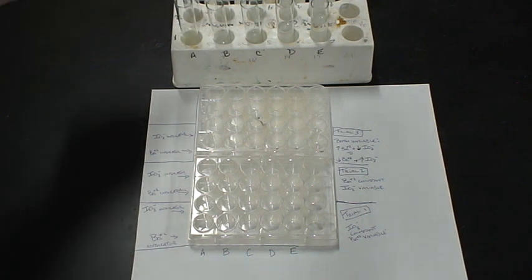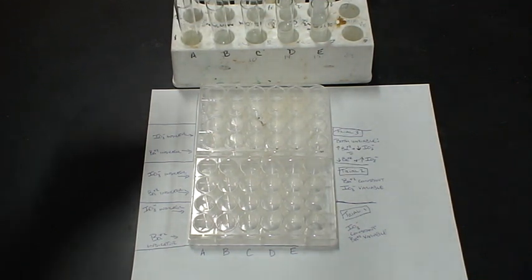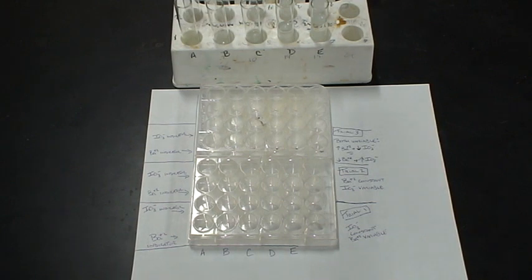What we're going to do is very carefully draw up some of that supernatant, and then the question is do we have barium or do we have iodate in that supernatant?